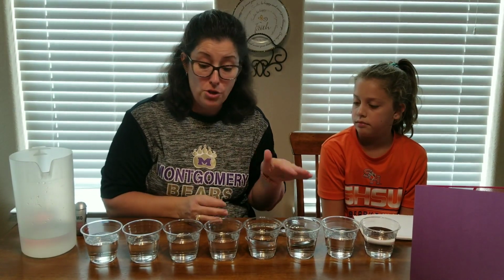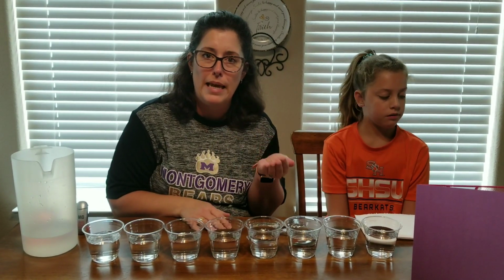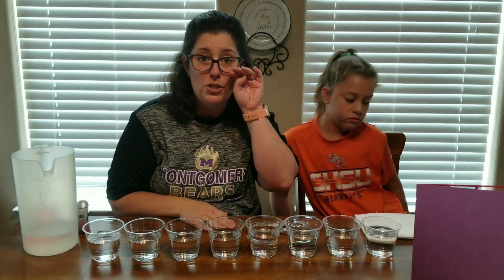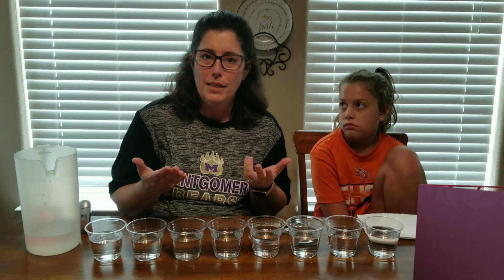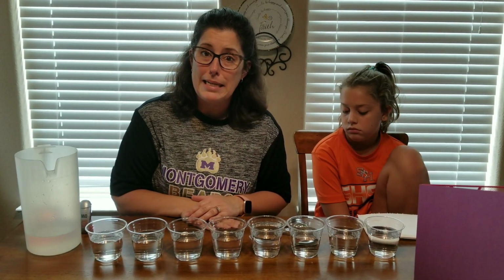But you're welcome as you go along to write them down as we do each substance. You can put yes or no on a sheet of paper if you think they will dissolve or if they won't. And then after you've watched the lab video and you see the final results, you can add a response to tell me if your hypotheses about the different substances were correct. So we're going to get started.